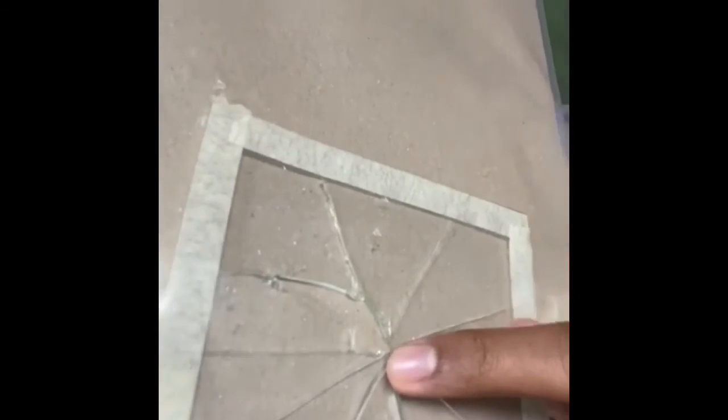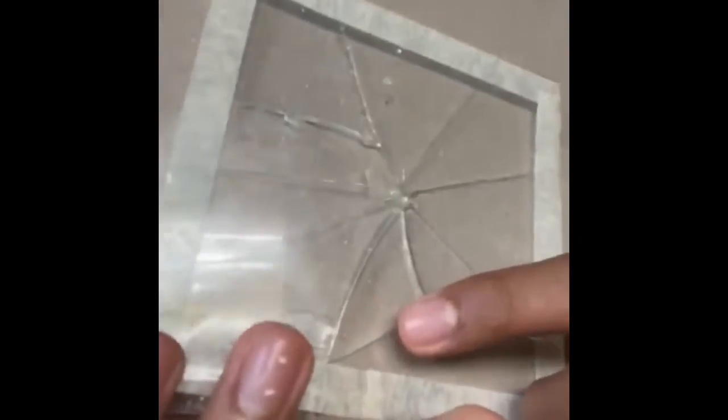So basically, this one right there was my first crack that I was able to do. It extended out here, and down there. My second crack was right here, and this one connected back to the first crack that I did, but it also extended out right here, out right here and right here, which kind of are in a circular pattern, but not really, so I'll just say it's radial.